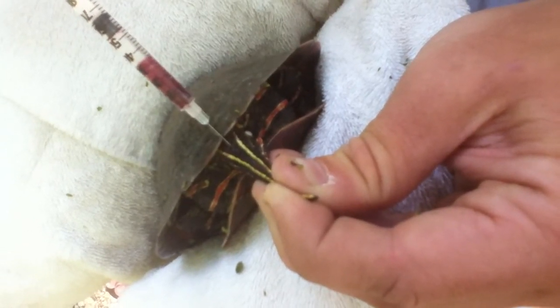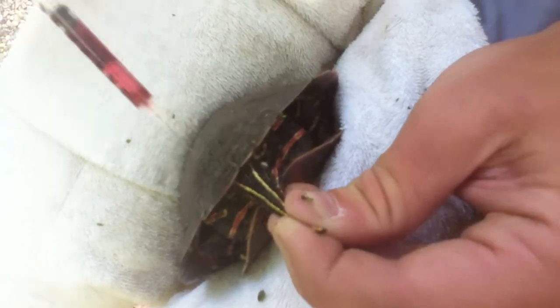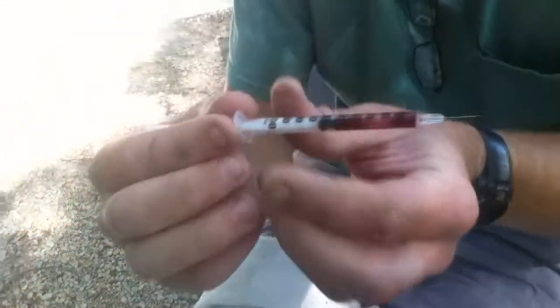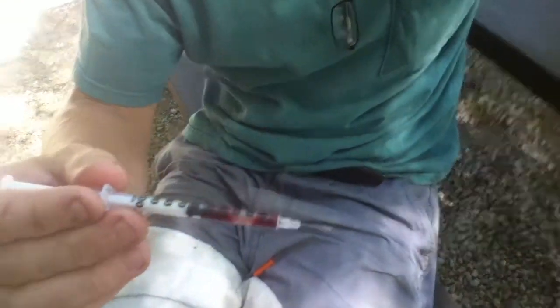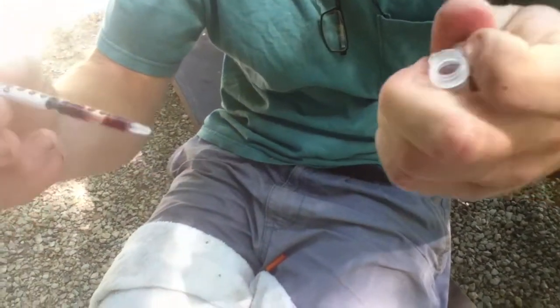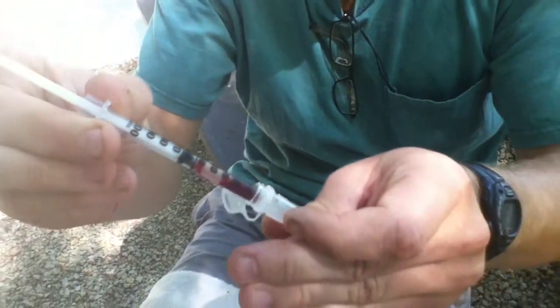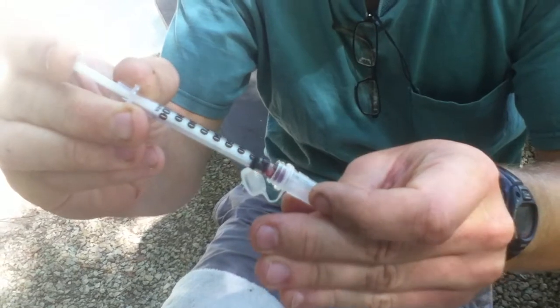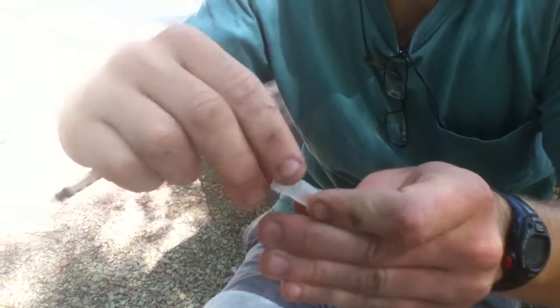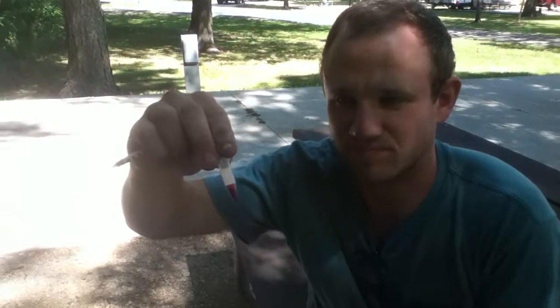That should be more than enough blood for our purposes. You can see here we've got plenty of blood and I'll put it in here. The turtle's fine, we've got our blood sample and that's how we do it. There you go.